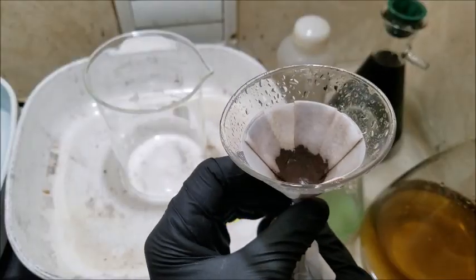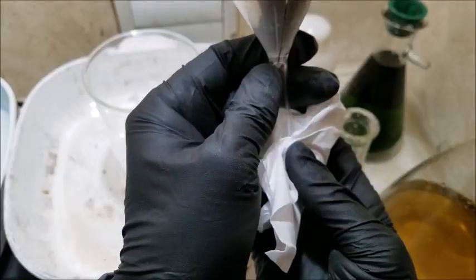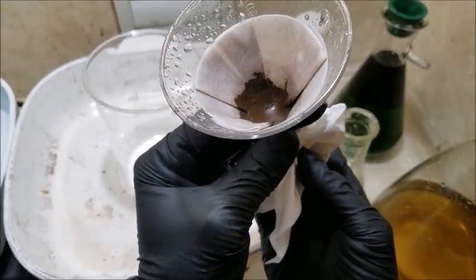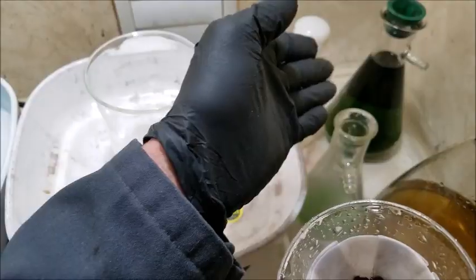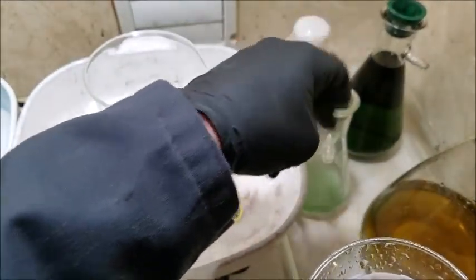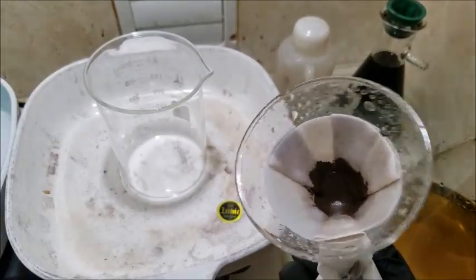Well, I can't say that I have seen gold this color. It certainly looks like a lot more than it really is. This could be near pure gold. If we look at the solution that we filtered off, we definitely pulled out a lot of junky material away from our gold, if indeed this is all gold.